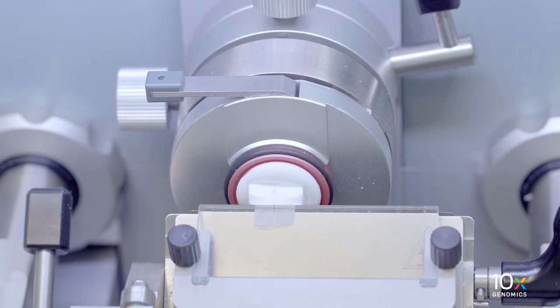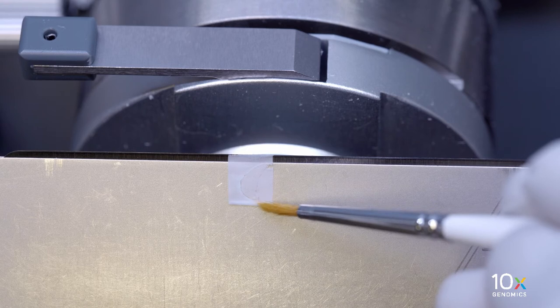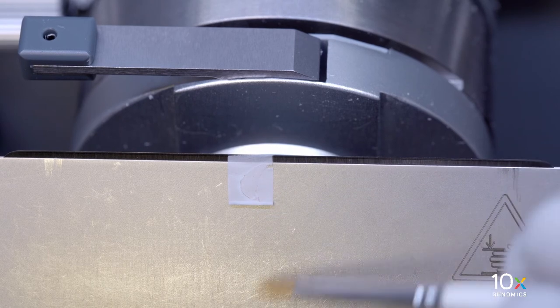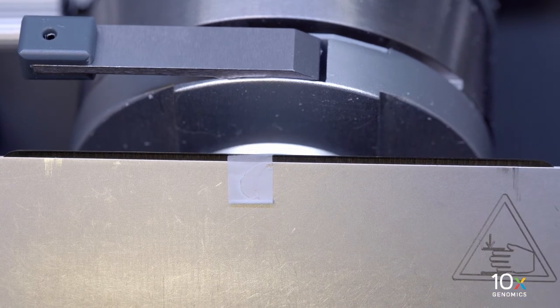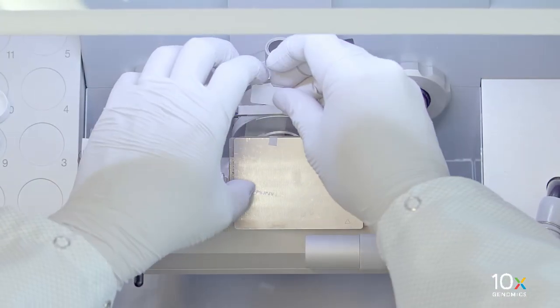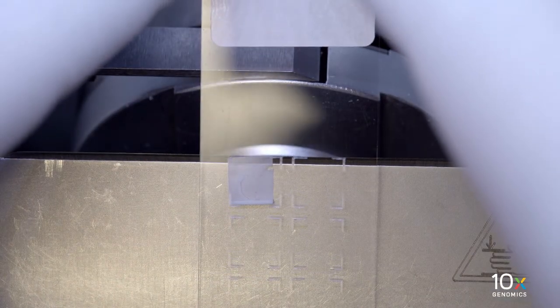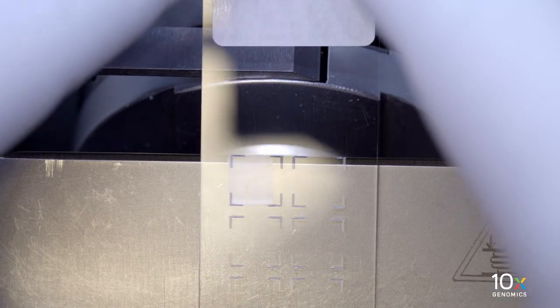Once the desired tissue section is obtained, carefully flatten it out by gently touching the surrounding OCT with cryostat brushes. Next, we will place the section onto the Visium slide. Place the section within a capture area on the pre-equilibrated Visium Spatial Slide by gently touching the section with the active surface of the slide.